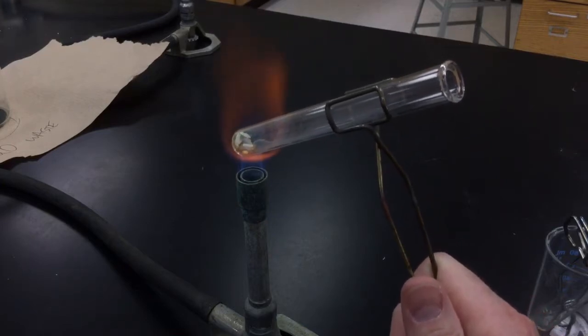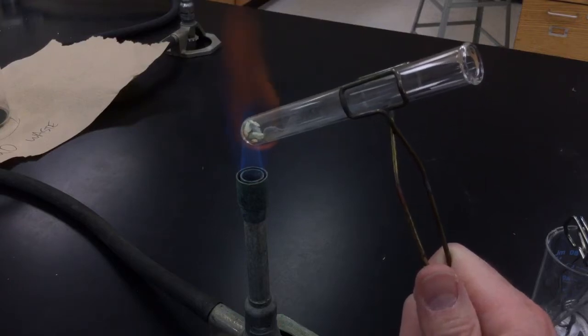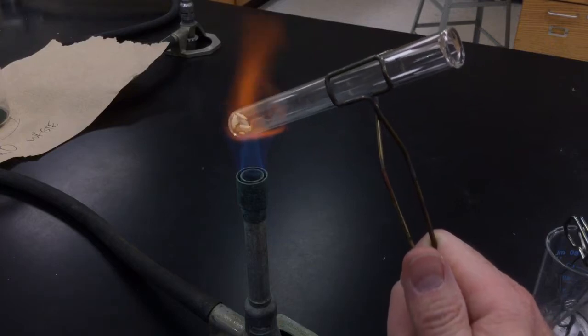I don't know how easily we can see it in the picture. I'm noticing still a little bit of steam coming out. So I'm going to continue to heat this up until we don't see any more of that steam.